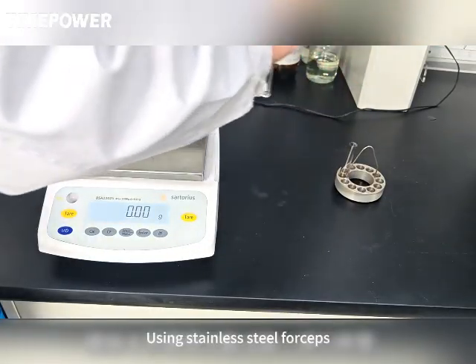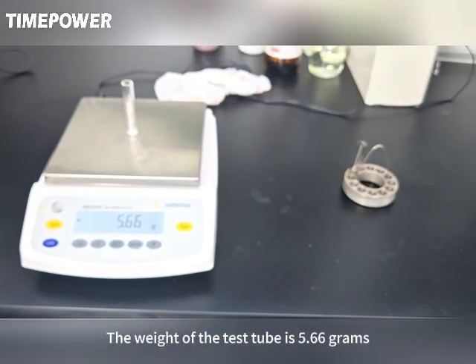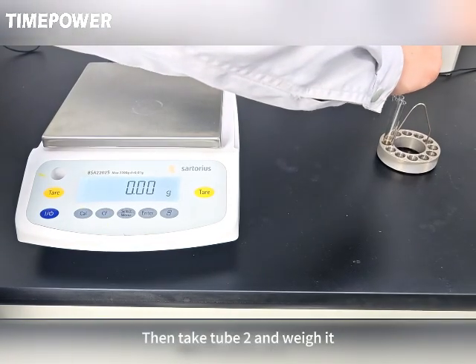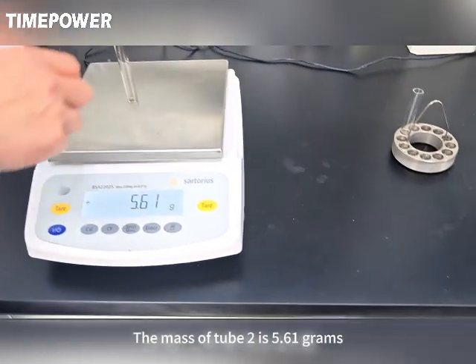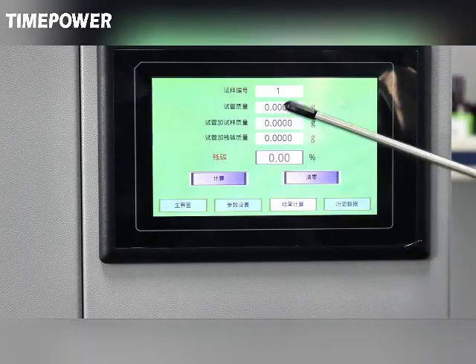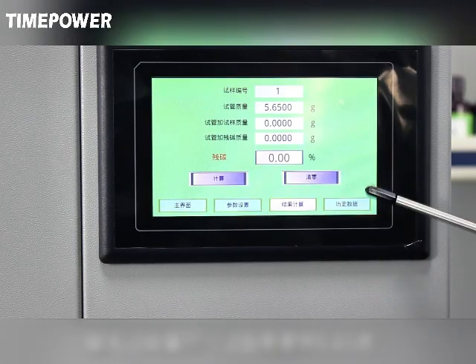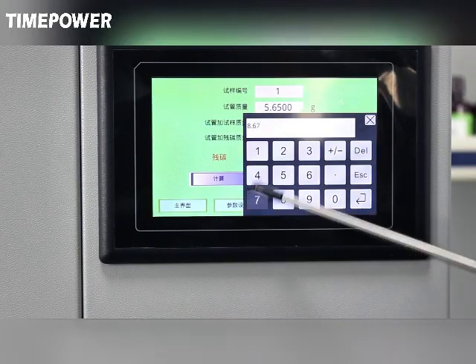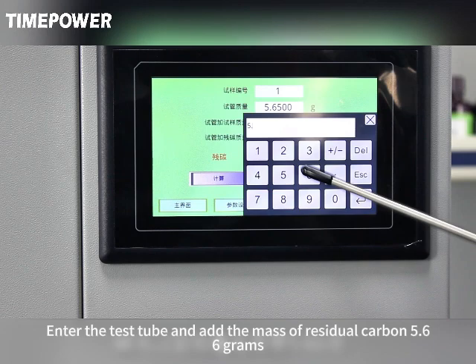After the sample tube cools, clear the balance. Using stainless steel forceps, take test tube 1 and weigh it. The weight of the test tube is 5.66 grams. Then take tube 2 and weigh it. The mass of tube 2 is 5.61 grams. On the main interface, click on result calculation. Enter the sample number, test tube mass 5.65 grams. Input test tube plus sample mass 8.67 grams. Enter test tube plus residual carbon mass 5.66 grams.